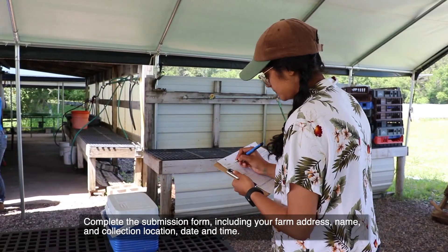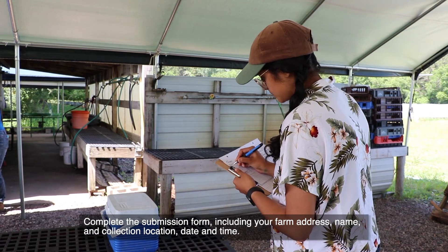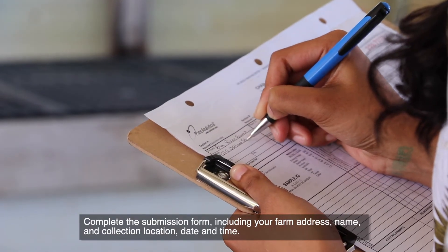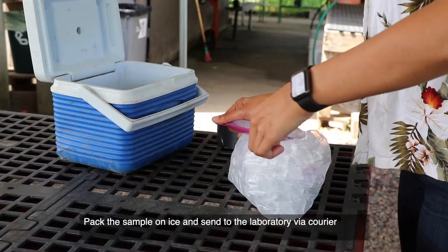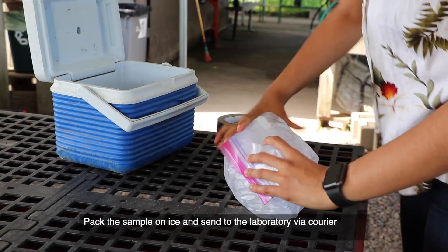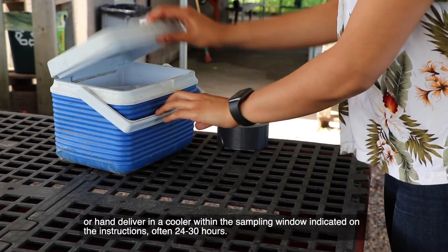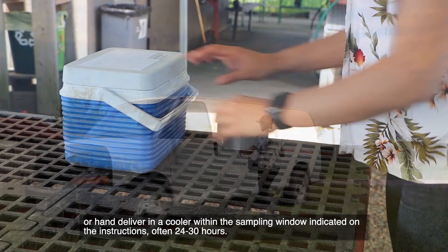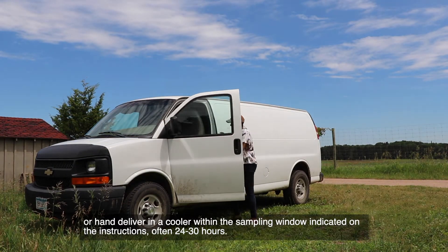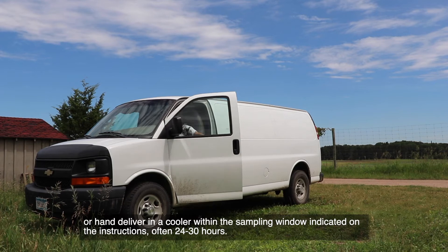Complete the submission form, including your farm address, name, and the collection location, date, and time. Pack the sample on ice and send it to the laboratory via courier or hand deliver it in a cooler within the sampling window indicated on the instructions, which is often 24 to 30 hours.